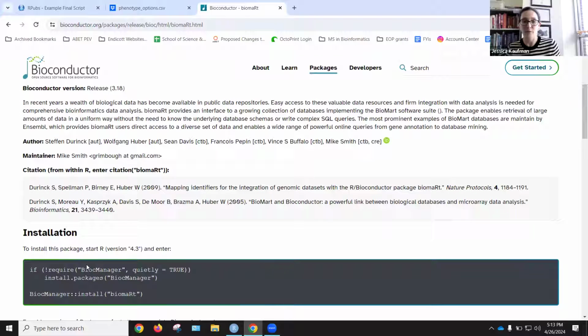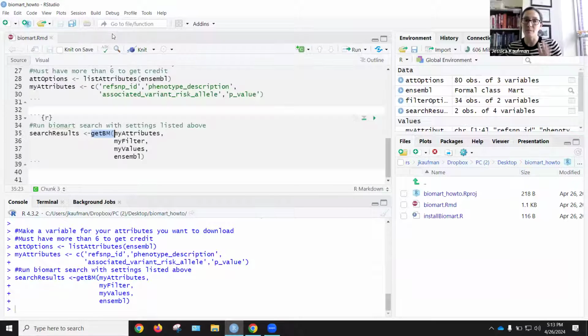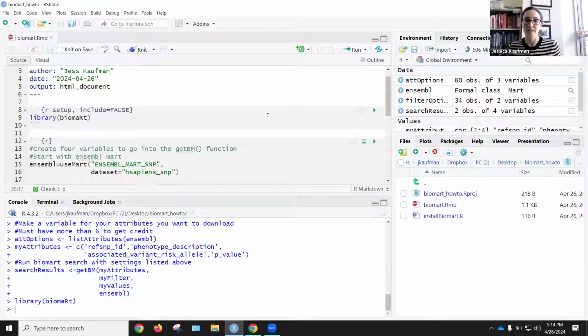Right here, if require BiocManager, I have set it as its own script. I made sure that I only ran that once, and once I knew that the package had been installed in this workspace, I close that script and make sure that I don't run it again. Every time I start up R, I do not need to reinstall biomart. I only need to run the library biomart command. So that is the first line of my markdown file, and my first code chunk is just run library biomart. I run that and I see that it works, and I'm all set and ready to go.